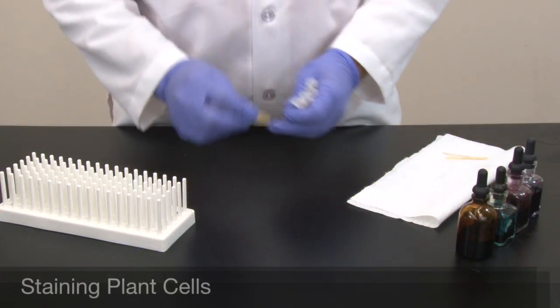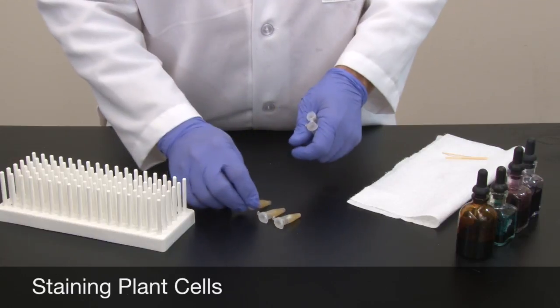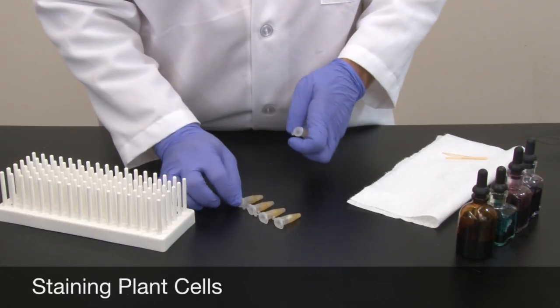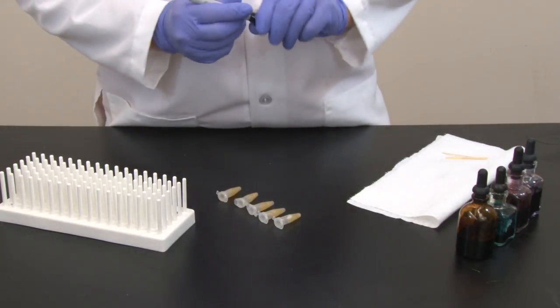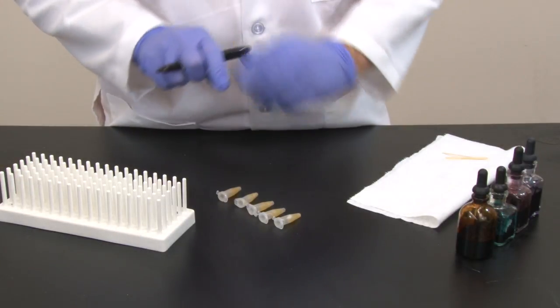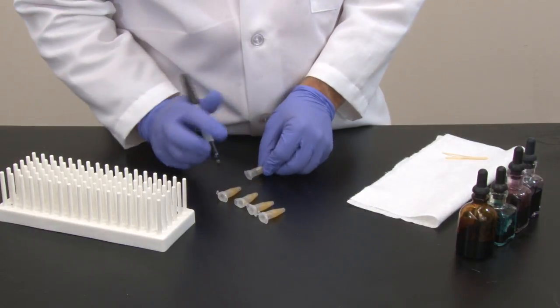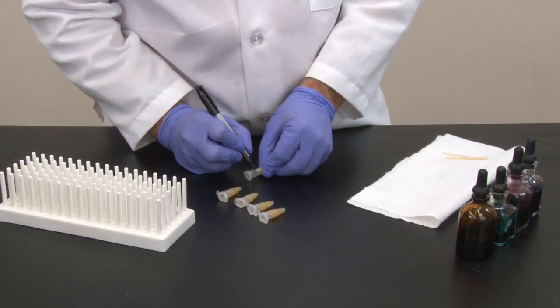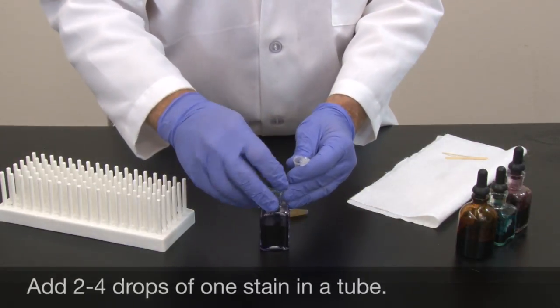Cells of the herbaceous plant body can be observed in many common foods. To view them, prepare a homogenate of the plant tissue by placing a small piece of fruit or vegetable in a blender with a small amount of water and blend for 10 to 20 seconds until there are no large chunks of tissue remaining. Place small amounts of the tissue into microcentrifuge tubes. Label the tubes with the name of the plant and the type of stain to be applied to it.